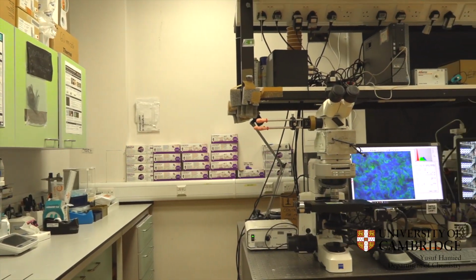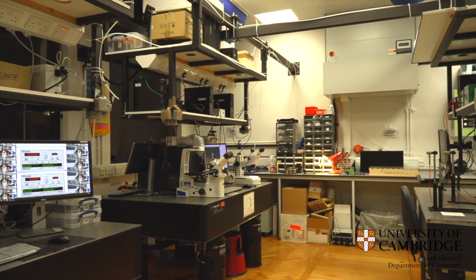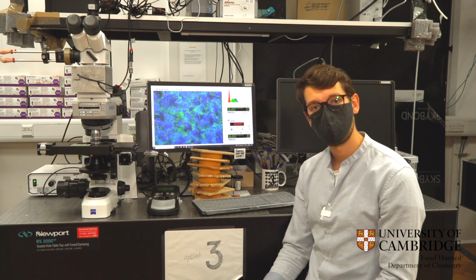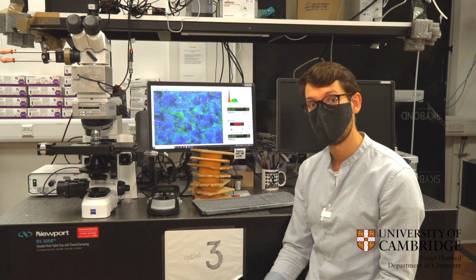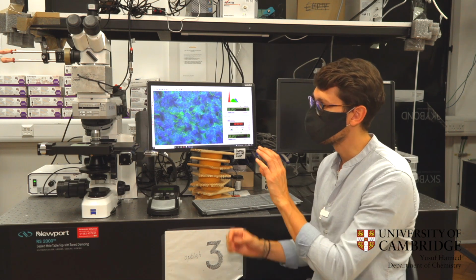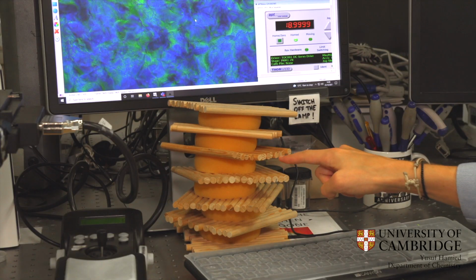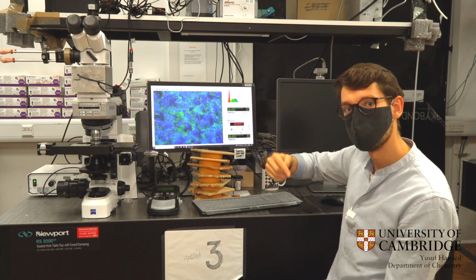In this lab, we characterize the visual appearance of our samples using optical microscopy and spectroscopy. So on the microscope here, we have a film made of cellulose nanocrystals, which are rod-shaped nanoparticles that we extract from natural cellulose. If we could zoom in and see the structure of the film, it would look something like this, with these layers of rods all stacked together in a left-handed configuration.